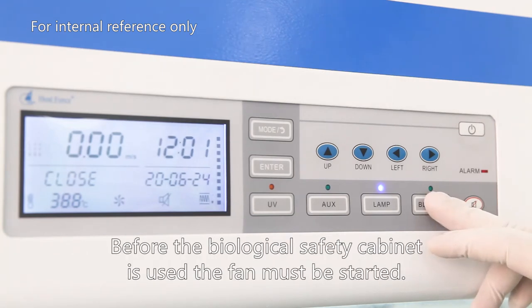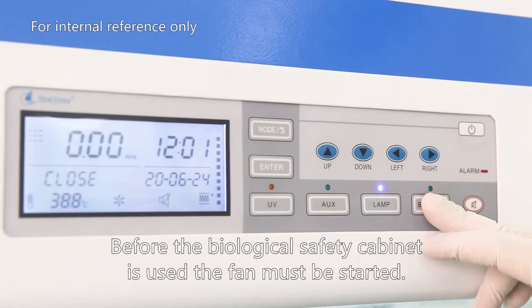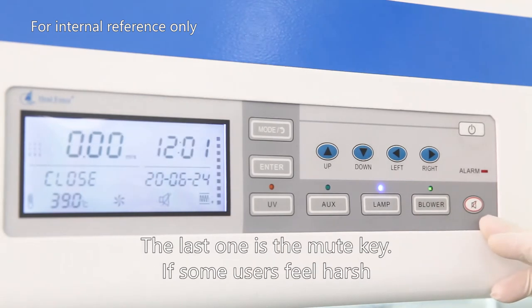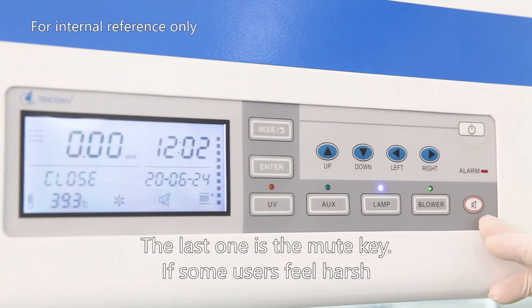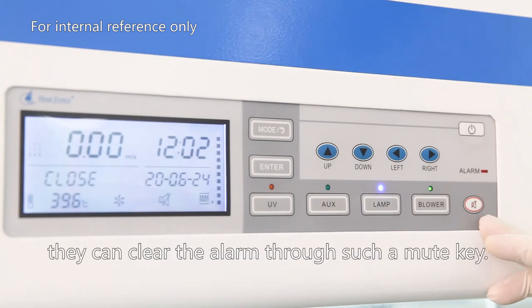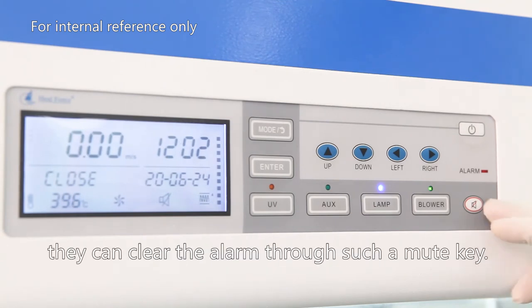Before the biosafety cabinet is used, the fan must be started. The last one is the mute key. If some users find the alarm harsh, they can clear the alarm through the mute key.